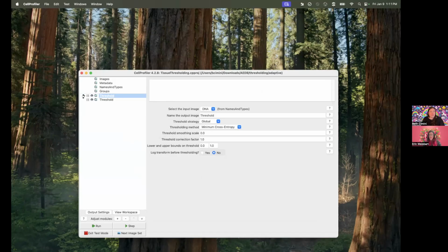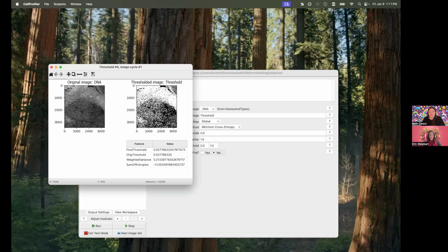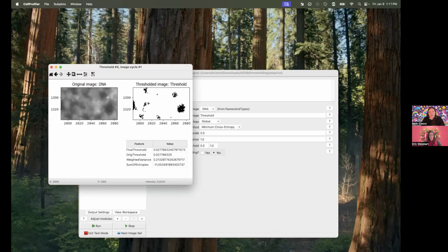So this is what she describes in her question. If I just threshold this, she didn't specify exactly which thresholding method she uses, but I suspect it's going to be the same no matter what. Here is what you get. And if I zoom in here, let's zoom in a little bit more, everything is being picked up, even things that are definitely not nuclei, they're between nuclei. But that's going to make it really hard to segment because CellProfiler thinks it should be counting these areas and it shouldn't. That's wrong.